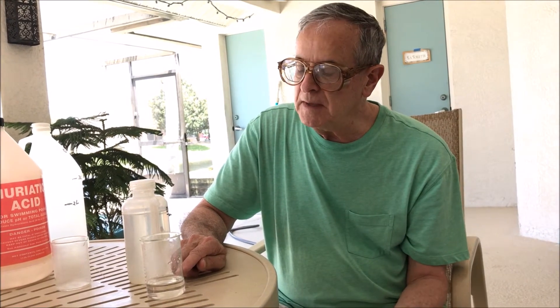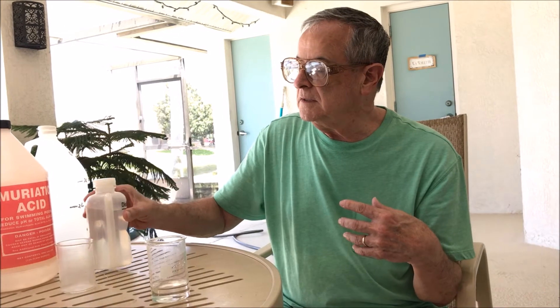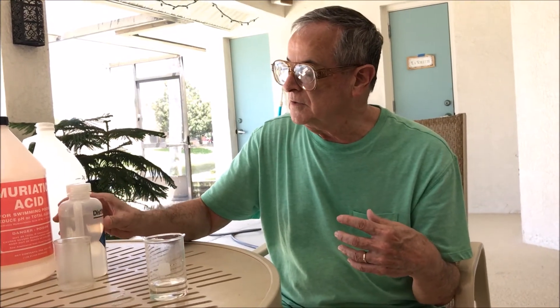We'll compare the actual yield to the theoretical yield. One thing I'm concerned about—it may be difficult to get all of the water out. If we get a percent yield that's greater than 100%, we know we've made some mistake.